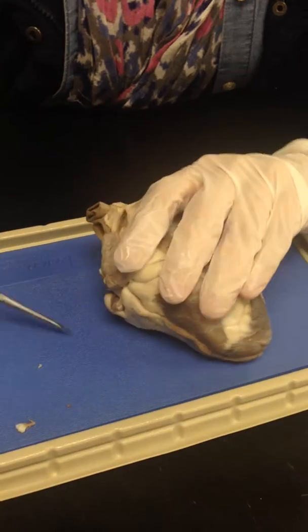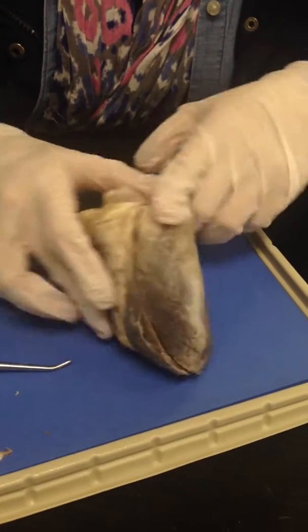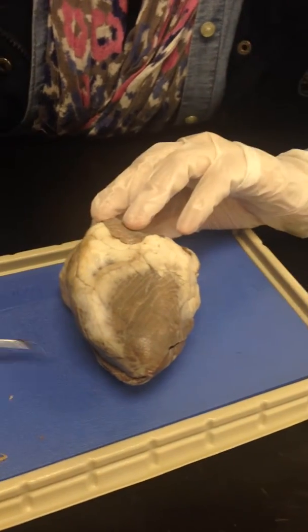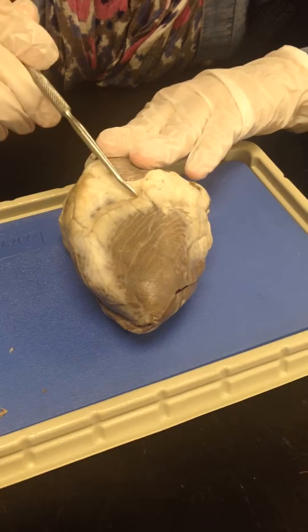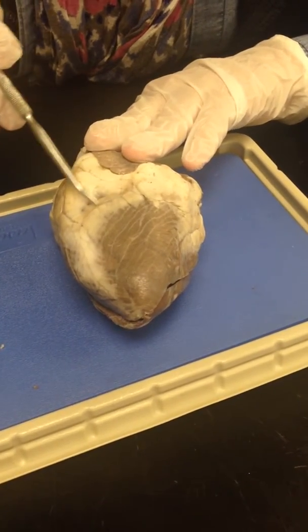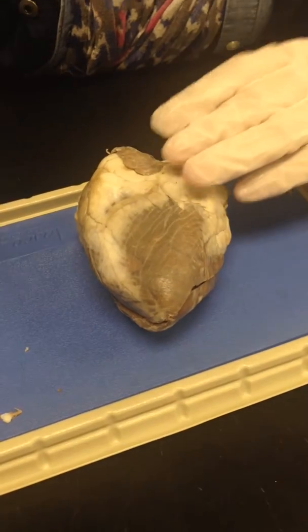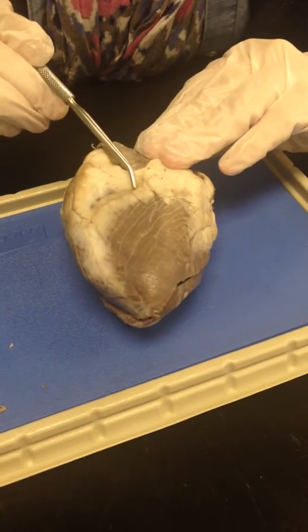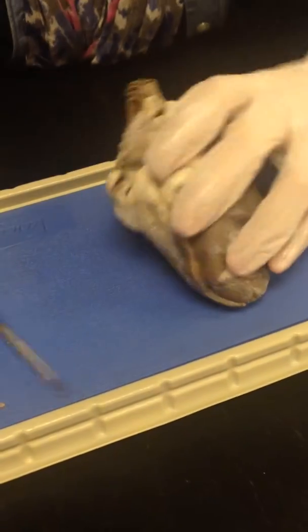So now let's talk about the flow of the heart. But first, we should know the coronary sinus, which is this kind of structure. If you want to find the posterior side of the heart, just remember the coronary sinus is always on the posterior side of the heart. Now again, to the blood flow.